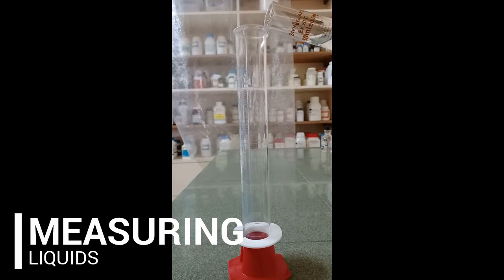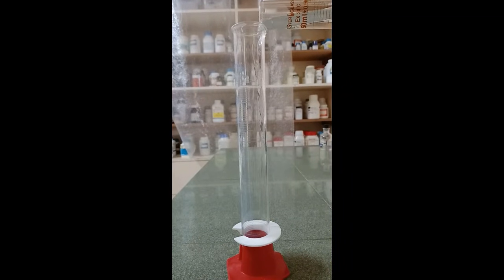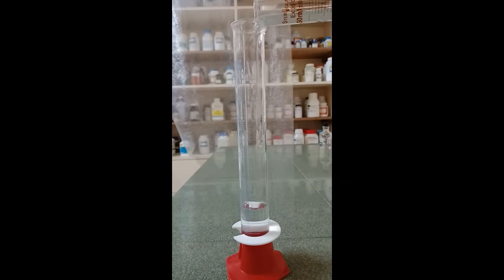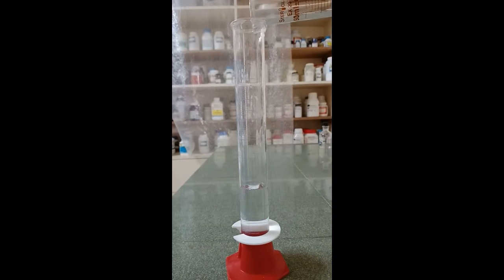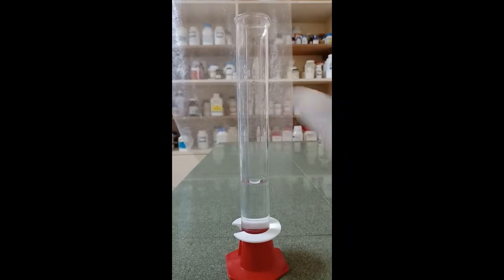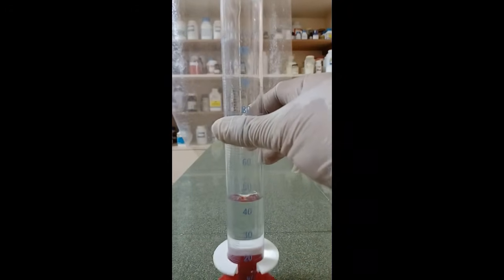Measuring liquids. Graduated cylinders are one of the common instruments used for measuring liquids. It is designed to measure the volume of a liquid. When we pour a liquid in the graduated cylinder, we can see that the surface of the liquid will be slightly curved. This curved surface is called a meniscus.